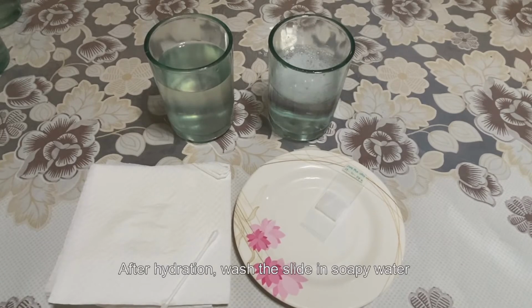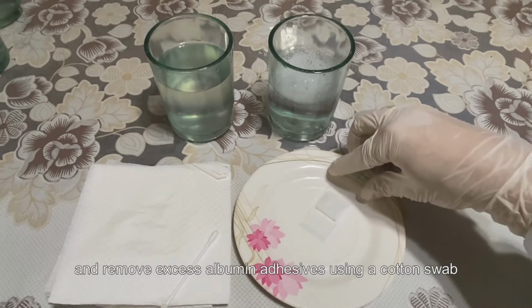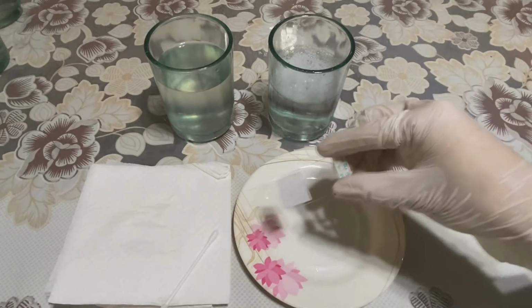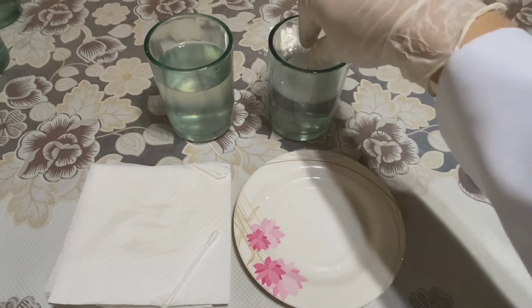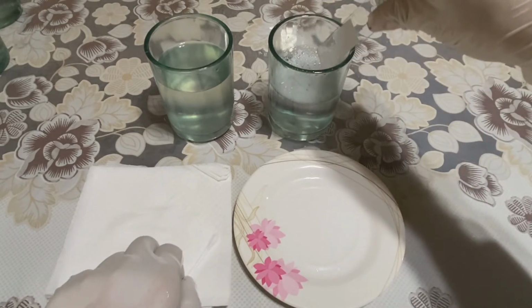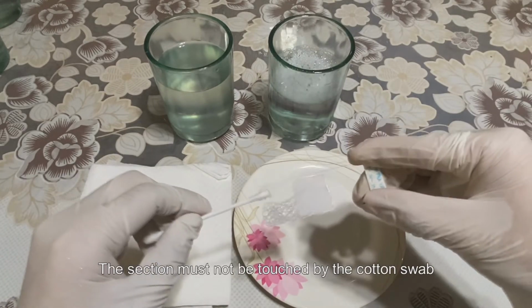After hydration, wash the slide in soapy water and remove excess albumin adhesives using a cotton swab. The section must not be touched by the cotton swab.